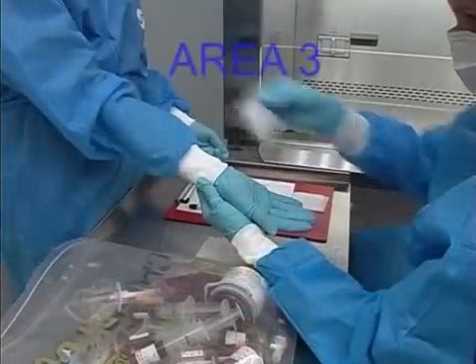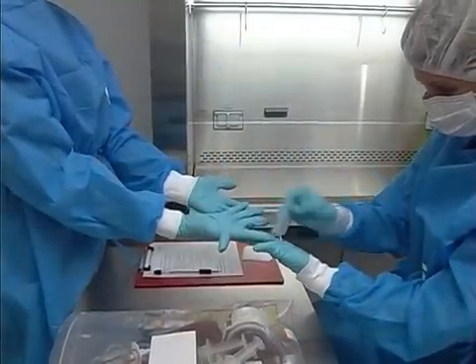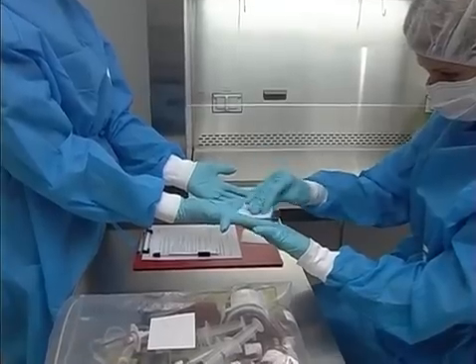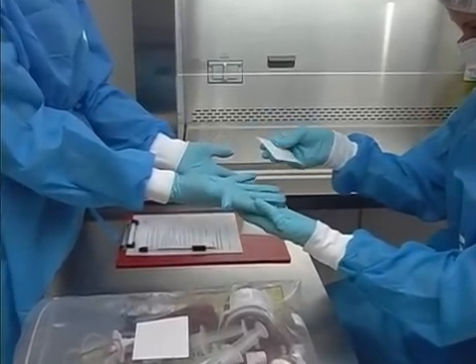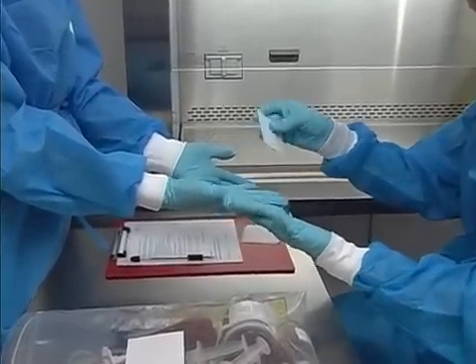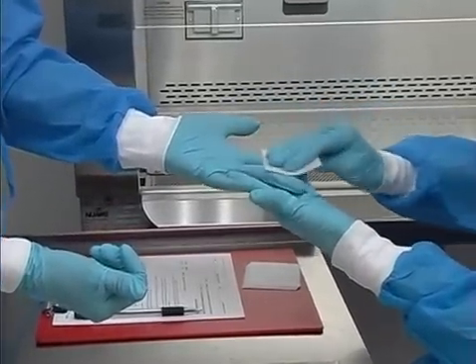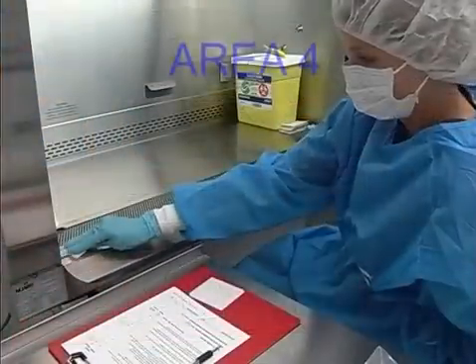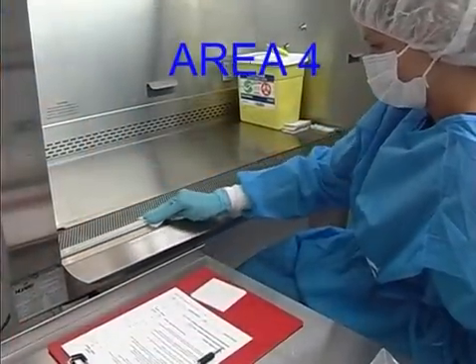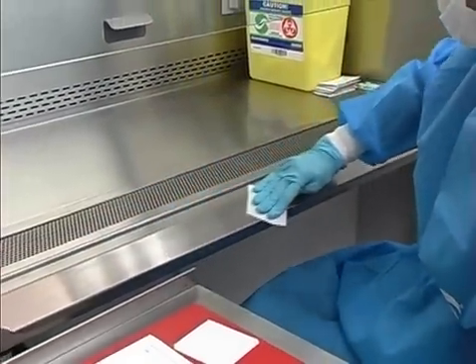Area 2: The outer surfaces of the products — the septa and injection port areas are the most commonly contaminated sites. Area 3: The candidate's gown sleeves and gloves, especially the fingertips. If proper procedure has been followed, the candidate should have properly removed and disposed of the outermost pair of gloves prior to removing hands from the hood, and the inner pair should be cleaned.